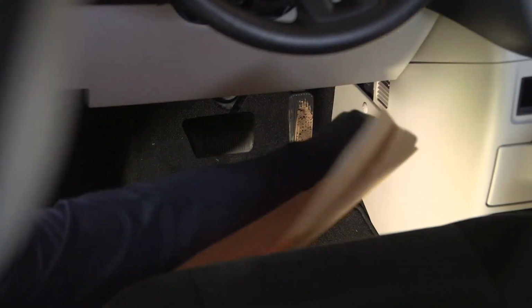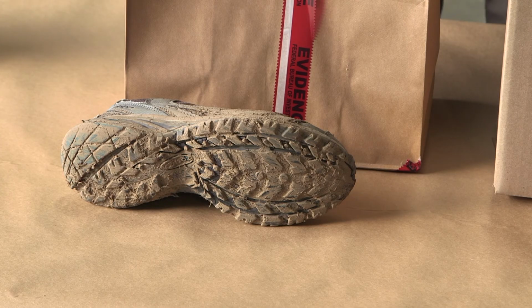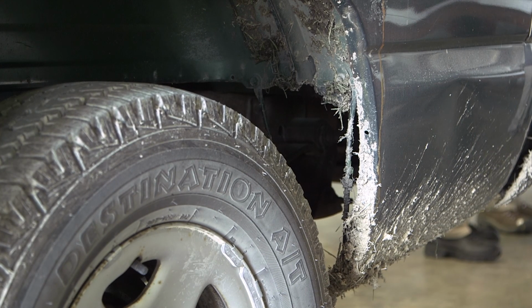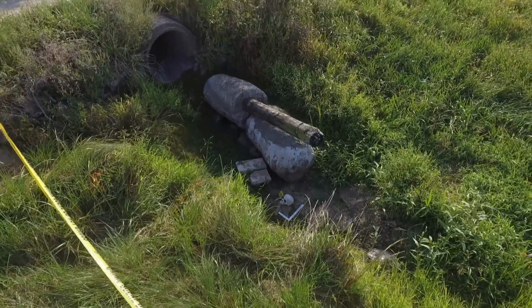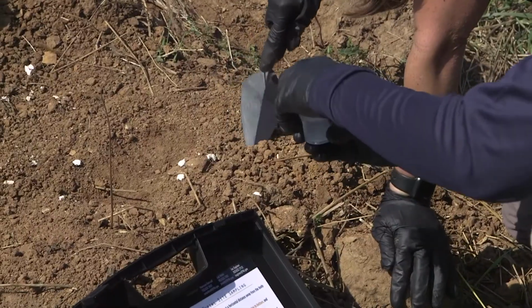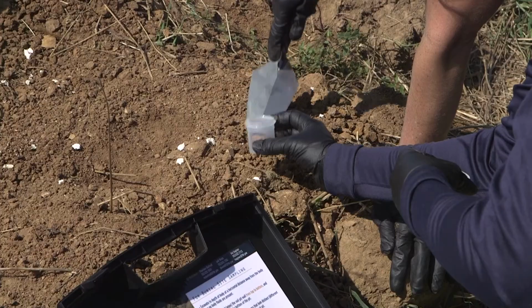Soil evidence can be useful for determining how and where an incident has occurred. Soil on evidence items like shoes, shovels, or vehicles may be compared to crime scene or alibi locations. Reference soils collected from these locations are often called known or exemplar samples. We will show strategies for collection of known samples and appropriate packaging for evidentiary items and known soils.